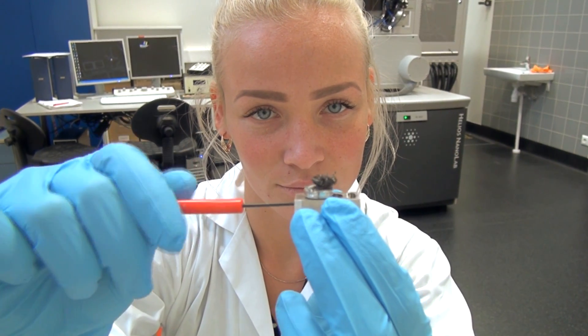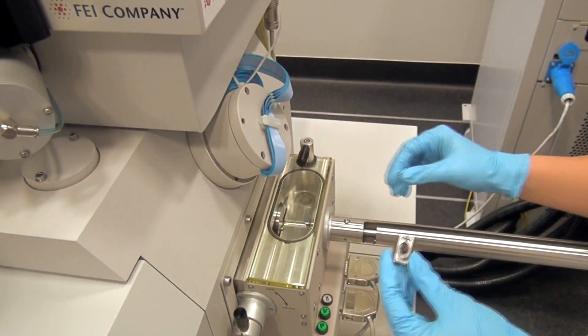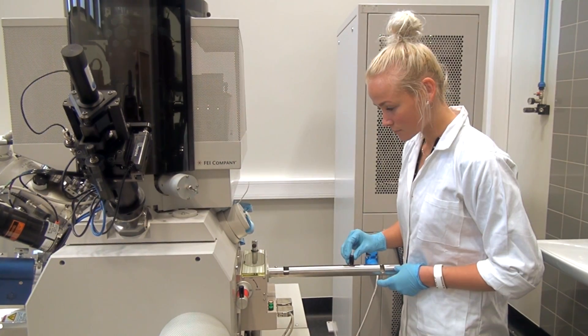Now that the sample is fully prepared, it can be inserted into the microscope through the airlock.